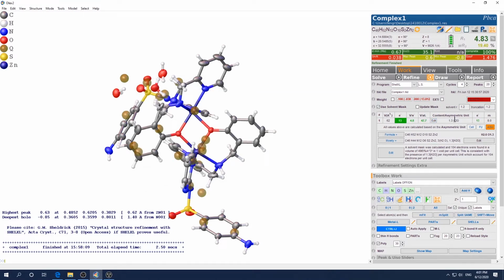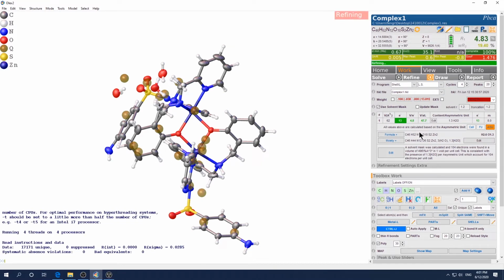Now you can see, of course, hydrogens, H2O have like oxygen have 8 electrons, hydrogen have 1, so 2 hydrogens is 2 plus 8 is 10. 1.3 times 10 is 13. So now you purposefully play with this number to match up the electrons you found here. Of course, they match. Now they all turn green. That means it's good. Then just refine. Okay, now everything fall in shape. Good shape. See? Perfect. Refine again.